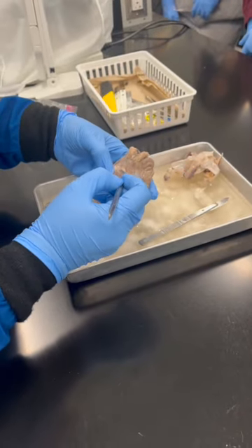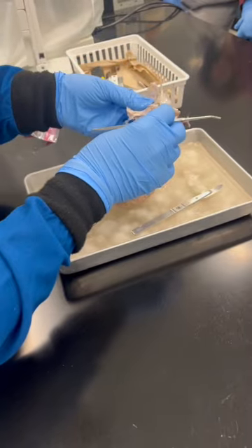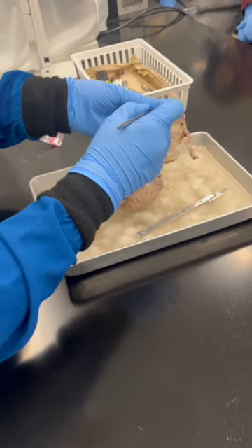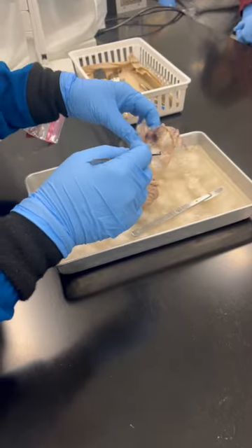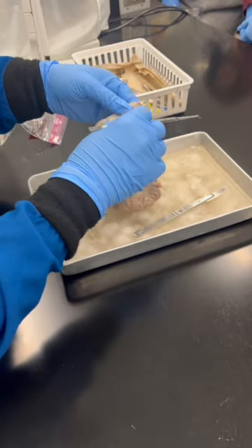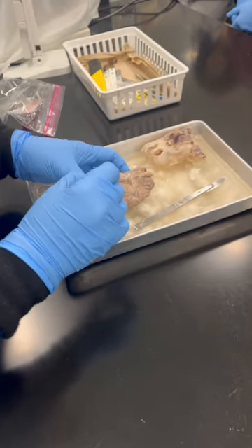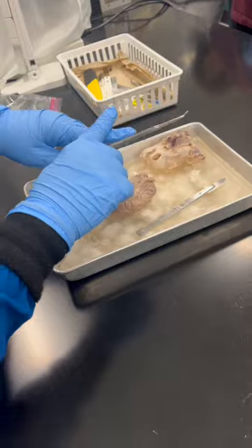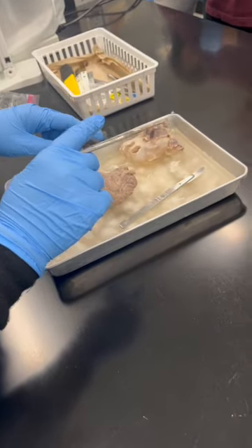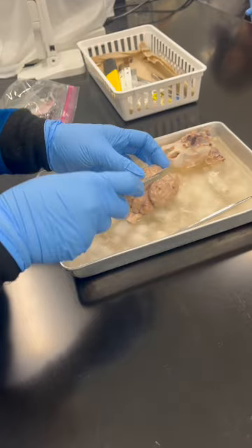The optic nerve is not clearly seen over here. Okay, the pituitary gland has gone this way. When you dissect, maybe you can try and get that. This should be over here, the optic nerve on both sides crossing over, forming what? Chiasm, the optic chiasm. So I'm going to dissect this one longitudinally.